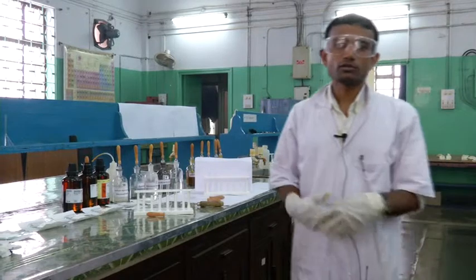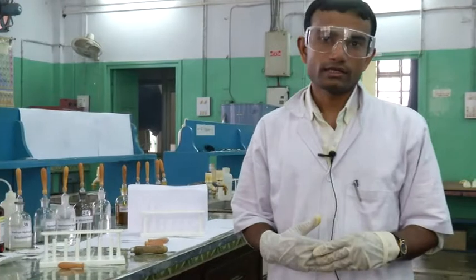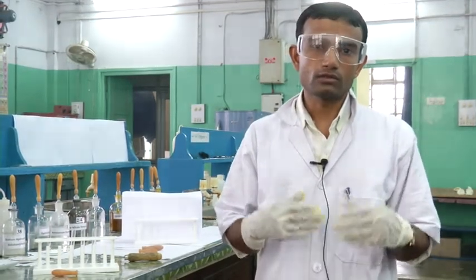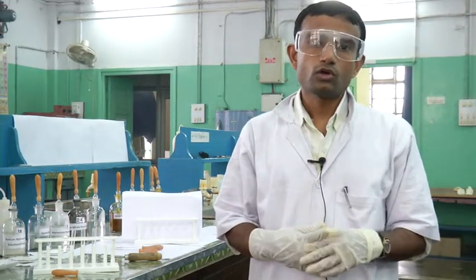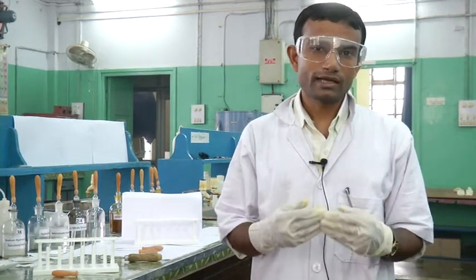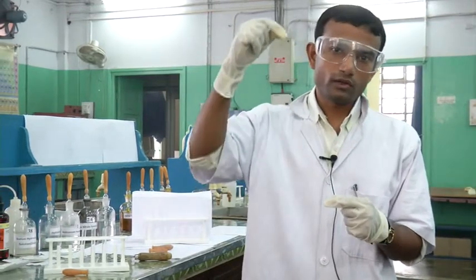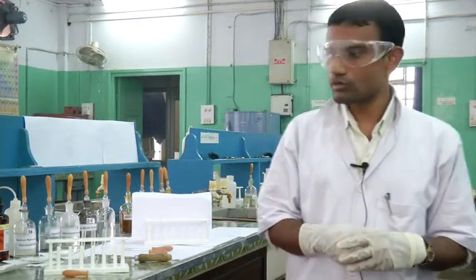Now I will show the test for hydroquinol, resorcinol, and salicylic acid. First we need to make their aqueous solution of the organic sample, then we will add ferric chloride and see how the coloration takes place. This is a very easy test. Specially for hydroquinol, we will observe a transient bluish green color, which is a bit tricky and will stay for only a very short period of time — just a few fractions of a second. We have to observe when the drop of ferric chloride enters the organic sample solution.